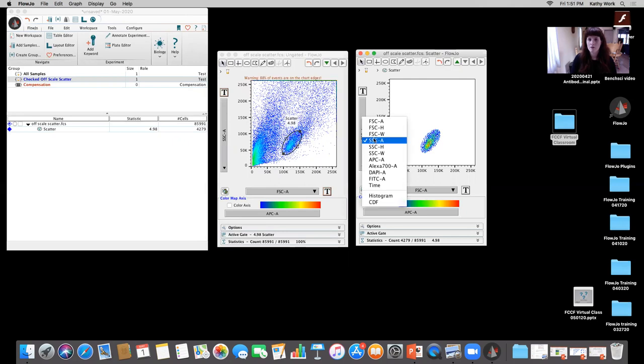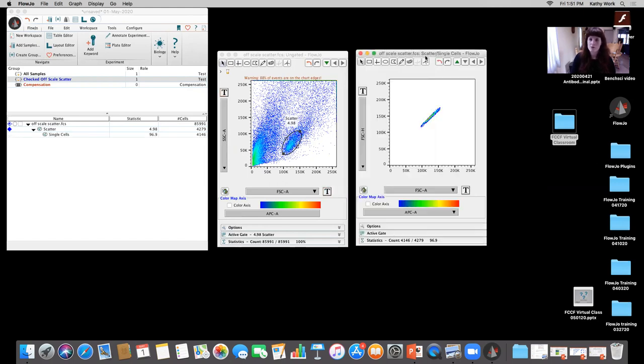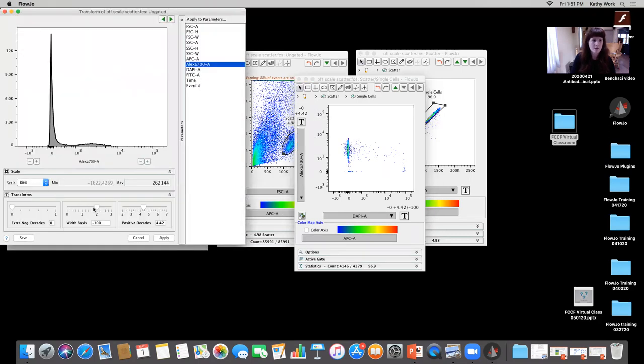Okay, do a quick singlet gate. Okay, FlowJo is smart, it automatically said those are your single cells based on the parameters I chose. And then what they were looking to do, they were looking for live cells that were Alexa 700 positives. Okay, come in here, I'm gonna customize the axis.